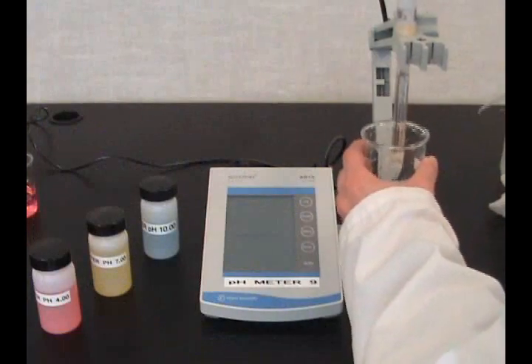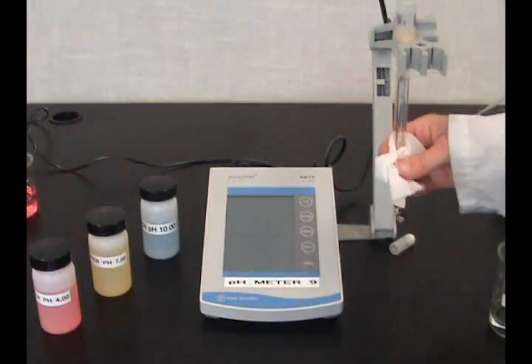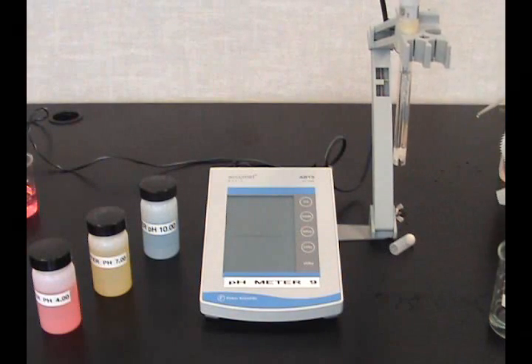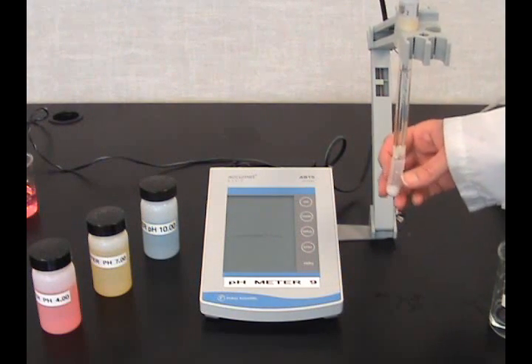When finished using the pH meter, rinse the probe and replace the cap. Make sure there is some moisture in the tissue on the bottom of the cap.